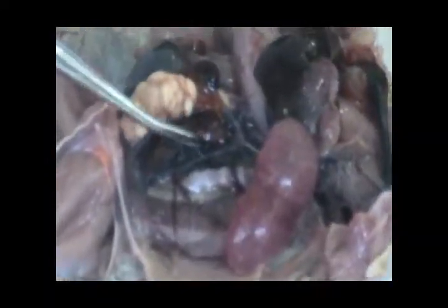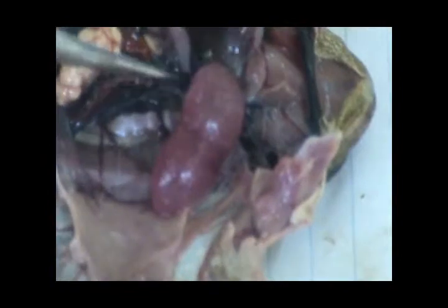These long things you're seeing are the kidneys. When the aorta reaches the kidney, it branches into four renal arteries.